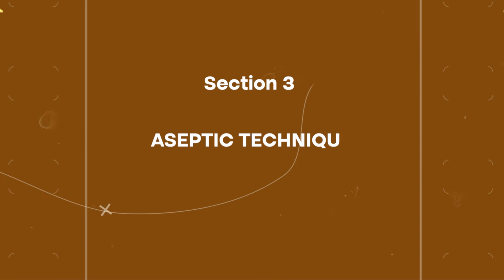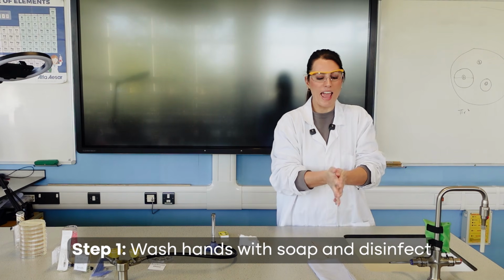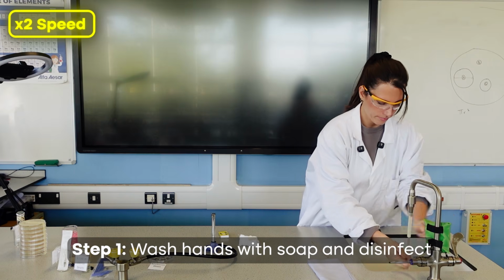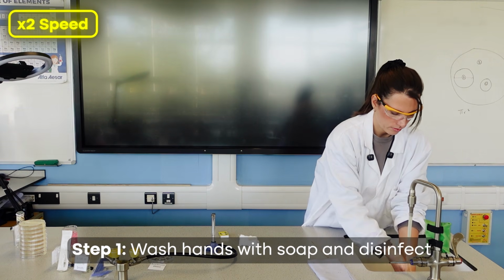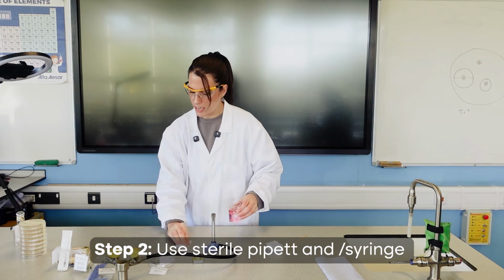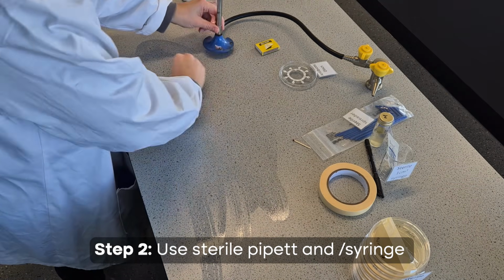So step 1, I need to wash my hands with soap to make sure that I'm removing any microbes on my hands so it doesn't contaminate our plates. Next, I'm going to dip my cotton wool in the Virkon and just sterilize the section of the workbench that I'm going to be working on.